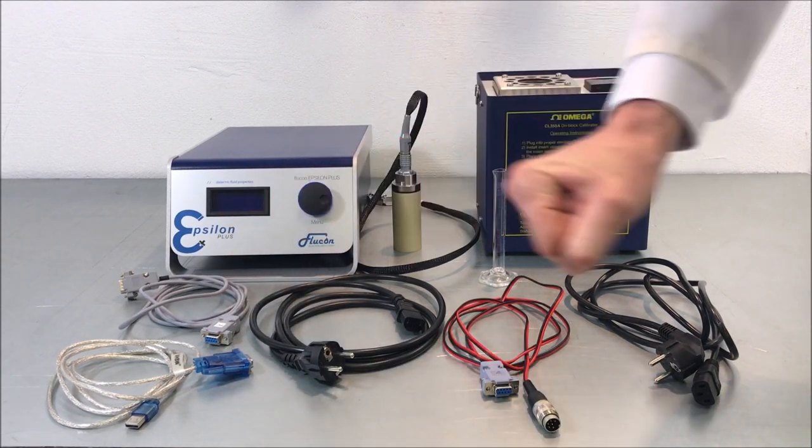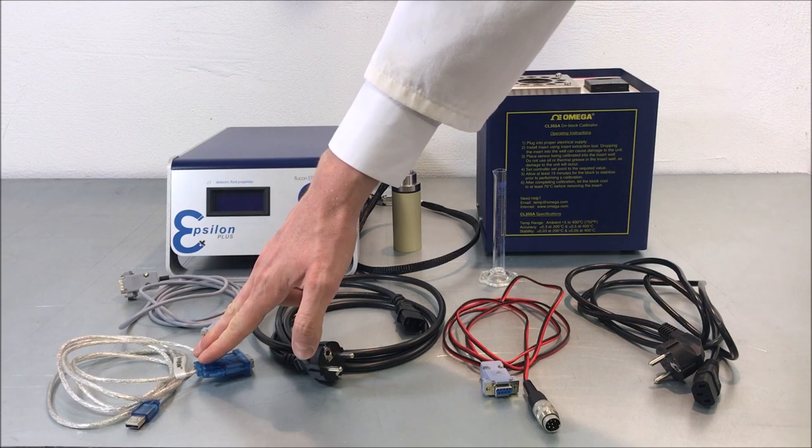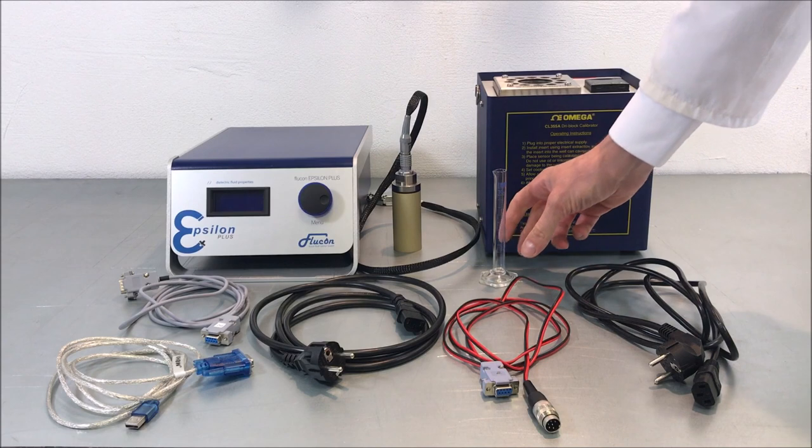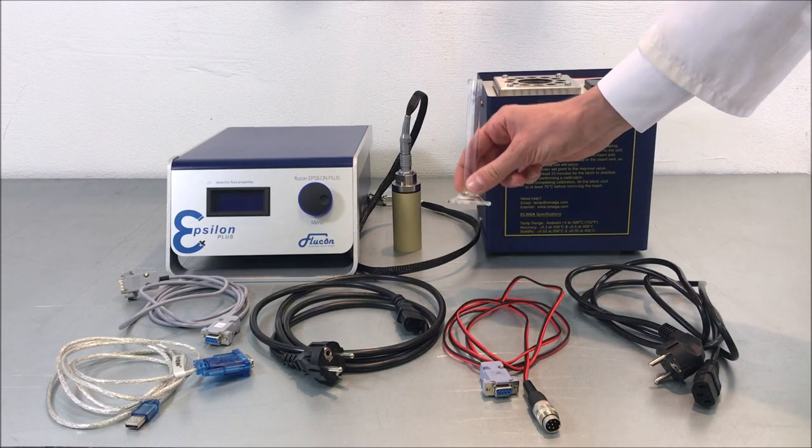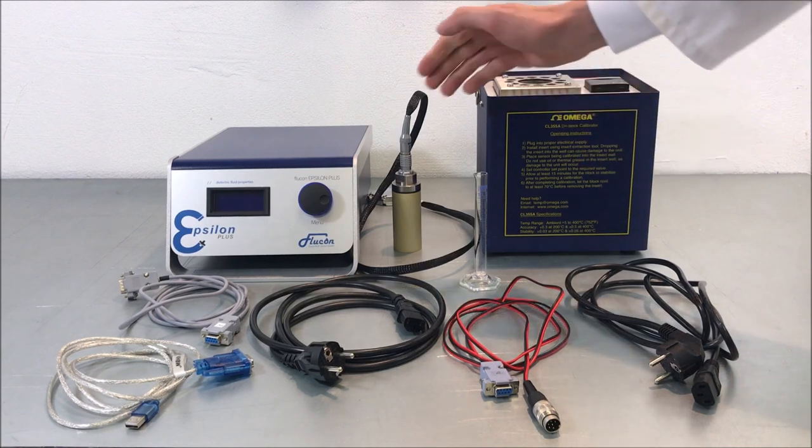To connect your Epsilon Plus device to your laptop or personal computer, you will find the PC cable. If no serial port is available on your computer, use this serial to USB adapter. Last, there is a glass cylinder to help you fill in your eight milliliter samples into the sample cup.